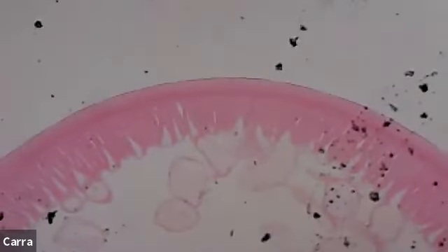Pseudocoelomate means that there is a coelom, but that all three of the tissue layers are not necessarily in contact with each other. And the coelom is what prevents two of the layers from touching each other. So the endoderm, or the gastrovascular cavity, is surrounded by space, or that pseudocoelom, and that separates it completely from the mesoderm and the ectoderm.